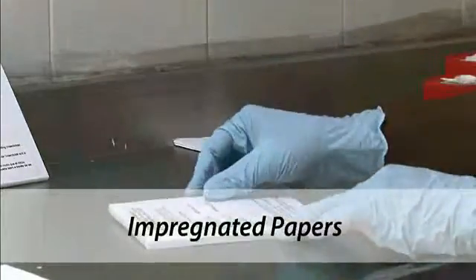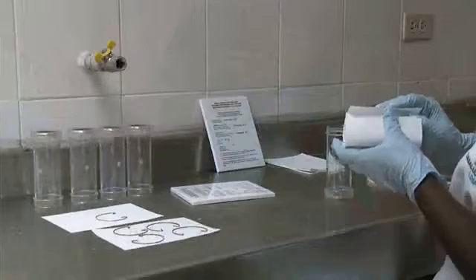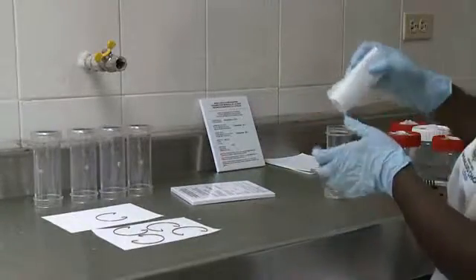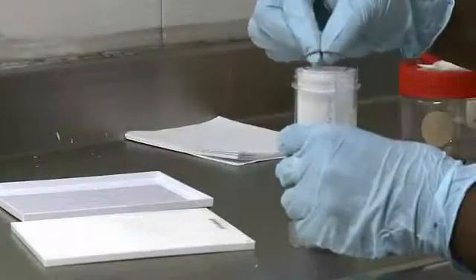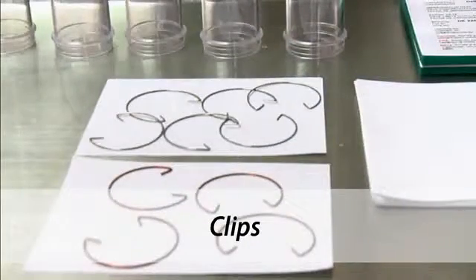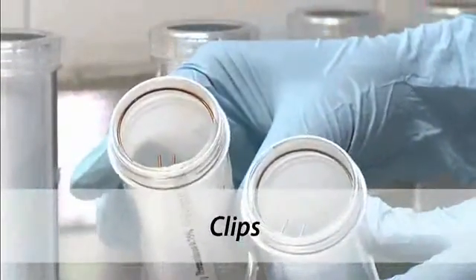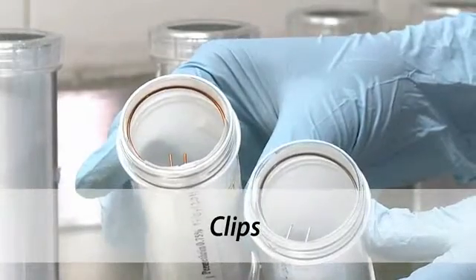Insecticide-impregnated papers are used to line the exposure tubes. White papers with no insecticide are used to line the resting tubes. The papers are fastened inside the tubes with metal clips. The copper clips are used for the impregnated papers, and the steel clips are for the resting tubes. When the test is finished, the clips should be stored separately.